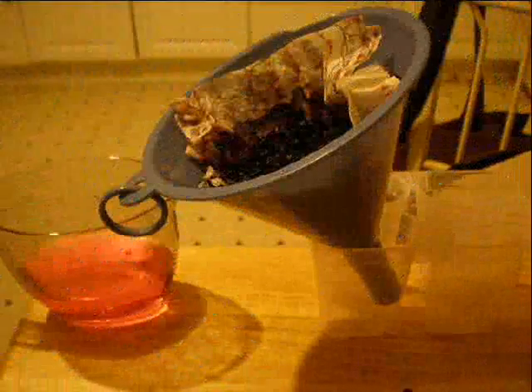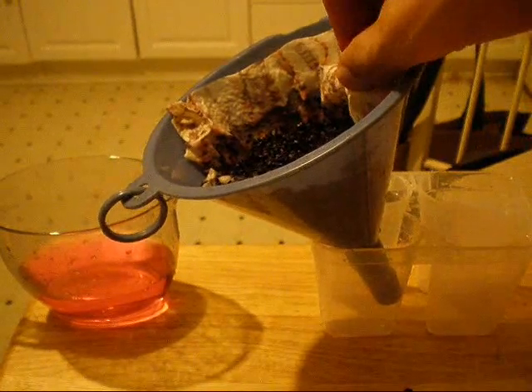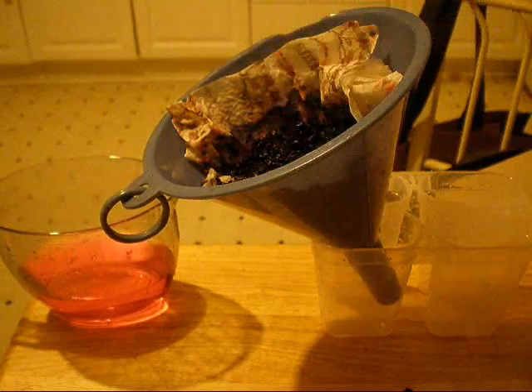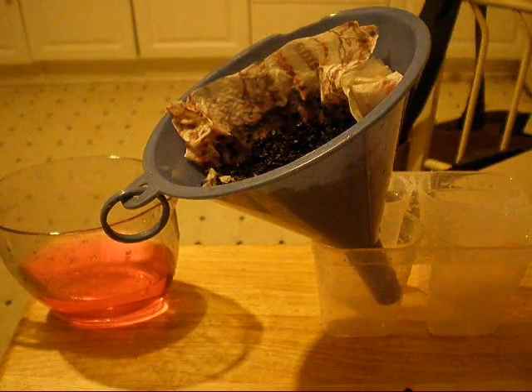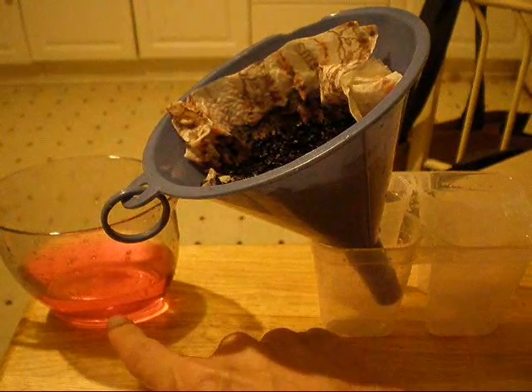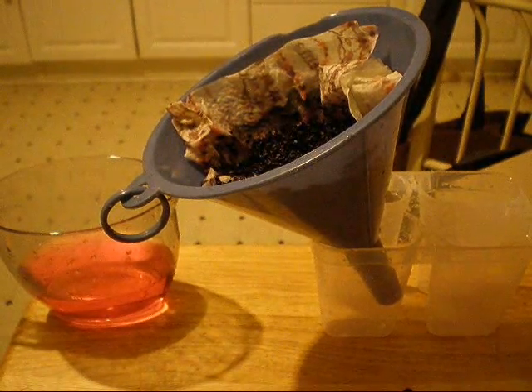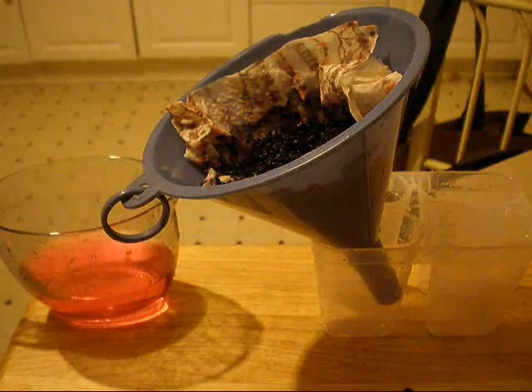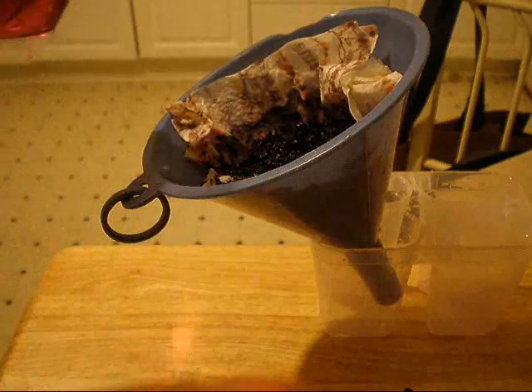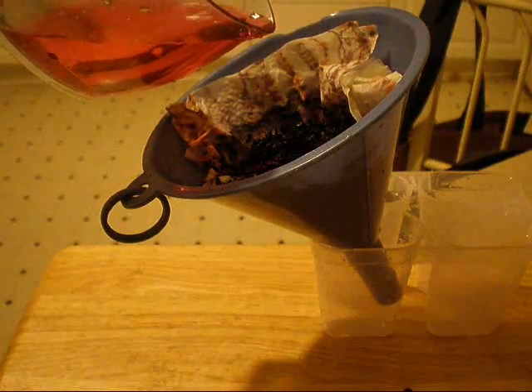Okay, here we have our funnel, our filter paper, and our 100 grams of activated carbon, as well as our receptacle and our 100 milliliters of water with one drop of food coloring in it. We are going to pour the water with food coloring through the activated carbon.